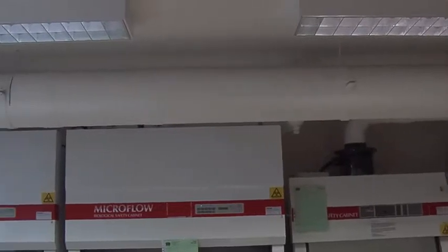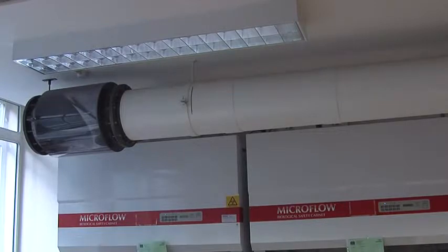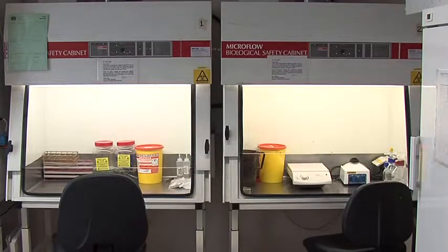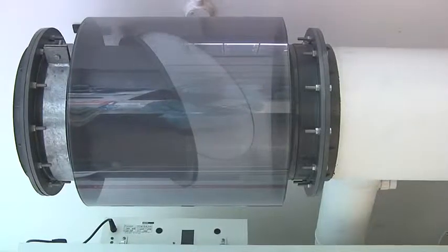The negative pressure is achieved using a dedicated air supply and air extract system. The air supply system will alarm if the negative pressure in the room is not maintained. The air extract system is provided by the Class 1 safety cabinets, through which airflow occurs via high efficiency particulate absorption (HEPA) filters. The negative pressure in the room ensures that the airflow is continually pulled towards the cabinets and the HEPA filters. All investigations on samples within a Containment Level 3 laboratory are performed whilst working in the Class 1 safety cabinets.